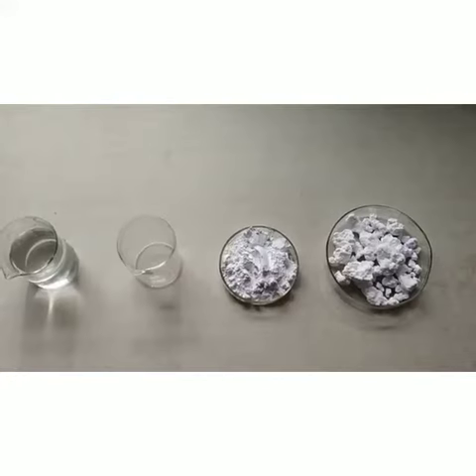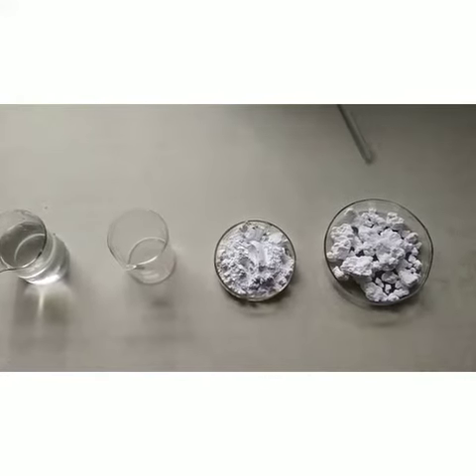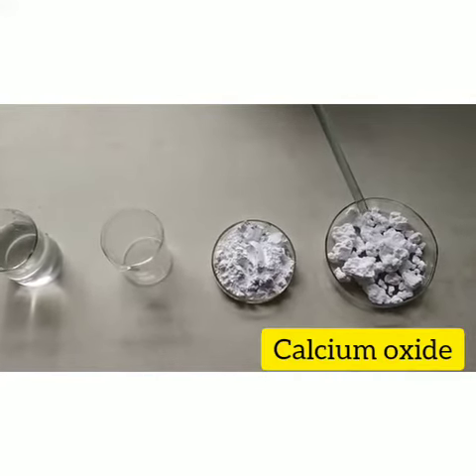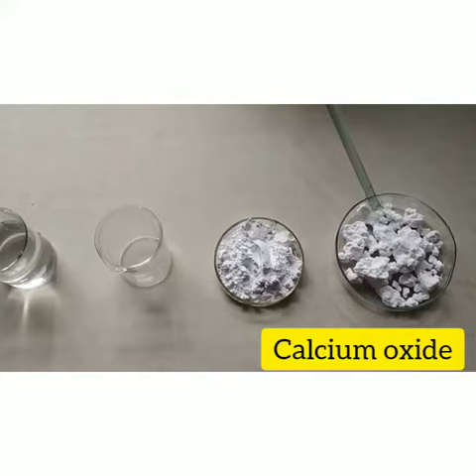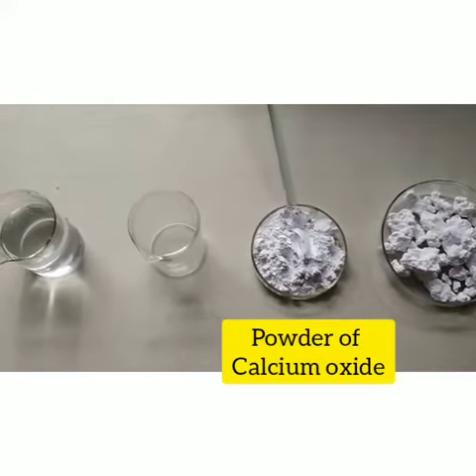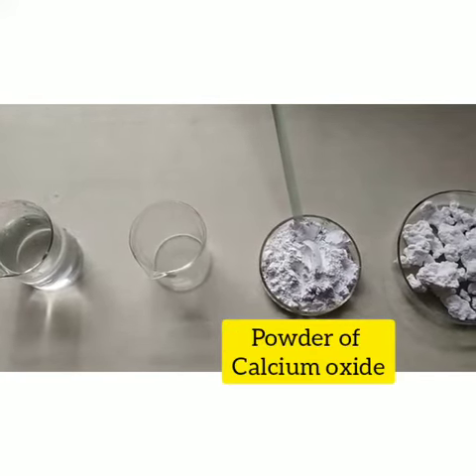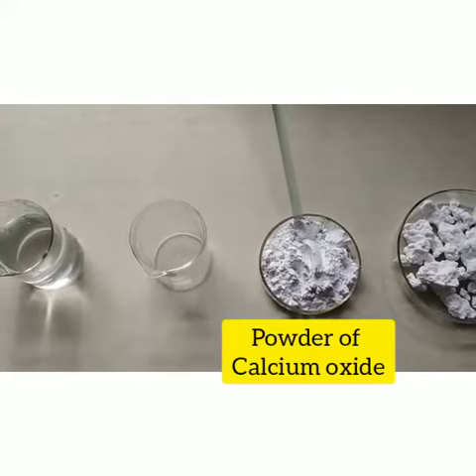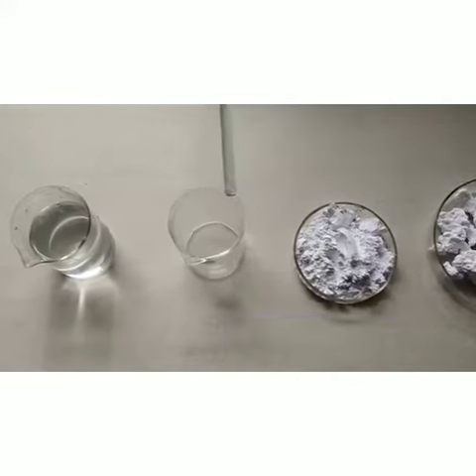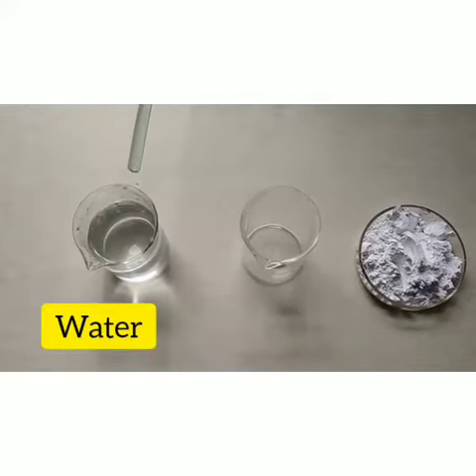The materials required are calcium oxide crystals. This is a powder of calcium oxide, a beaker, and water.